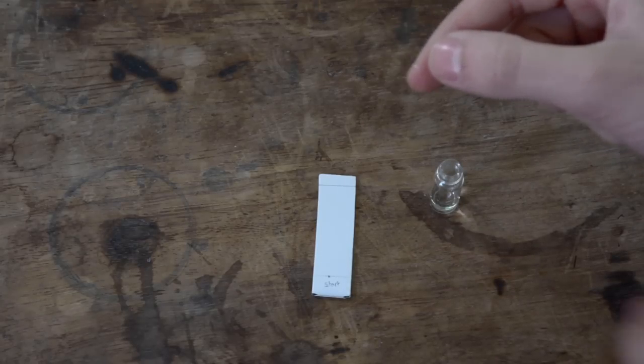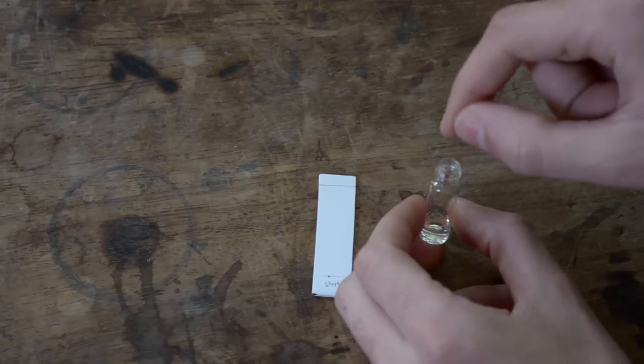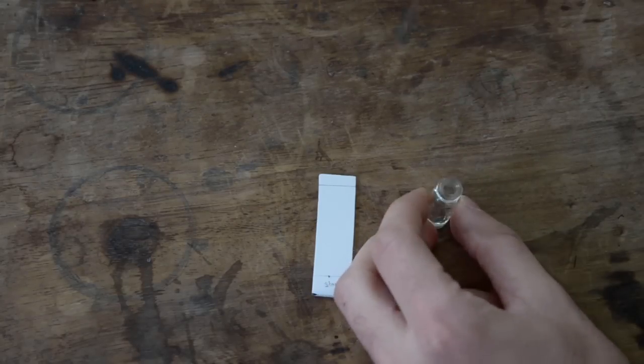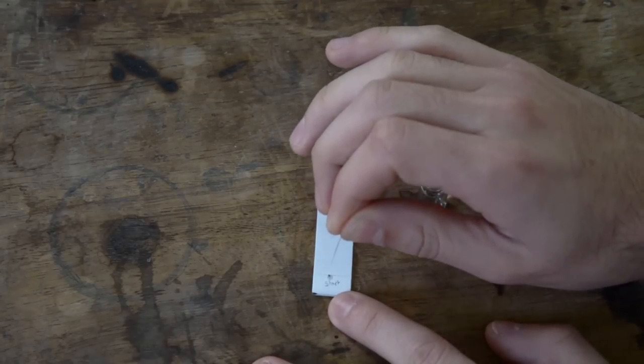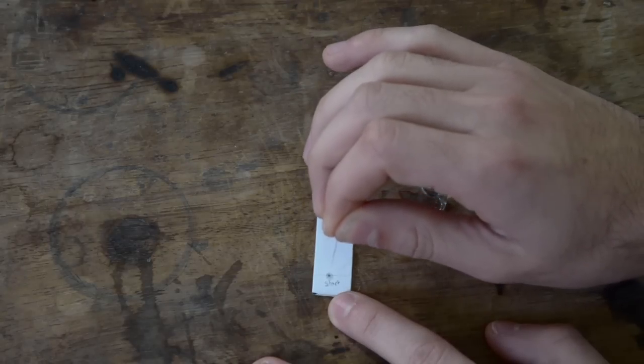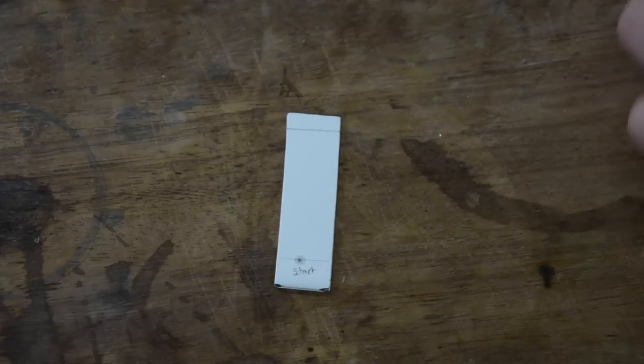Use a spotter cut down to a minimal size and immerse it slightly into your desired solution. Next, gently touch the spotter to the surface of the marked spot on the TLC plate to allow the solution to flow out and be absorbed by the silica surface.